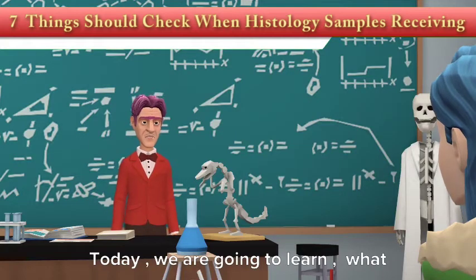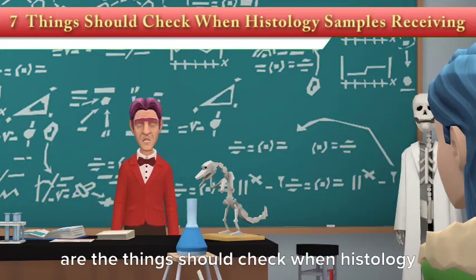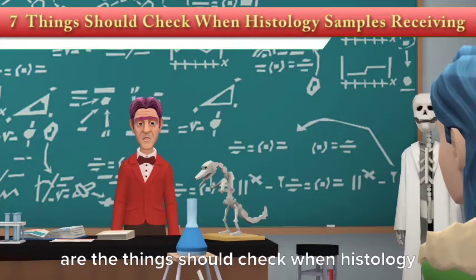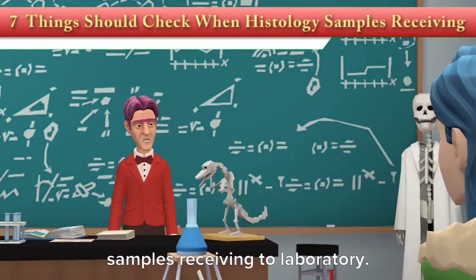Today, we are going to learn what are the things we should check when histology samples are received in the laboratory.